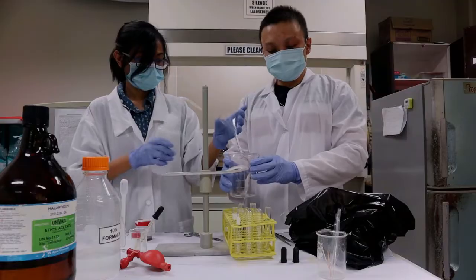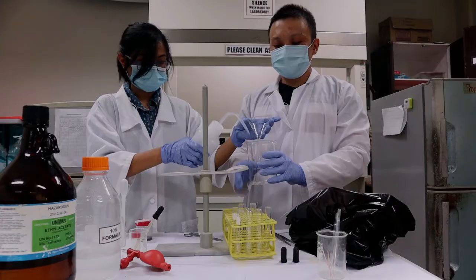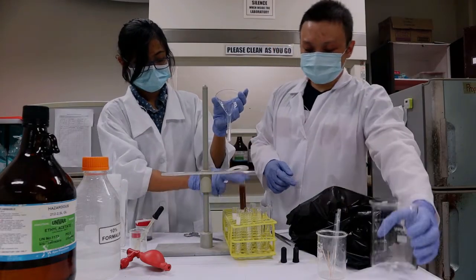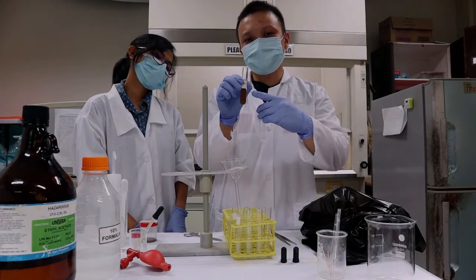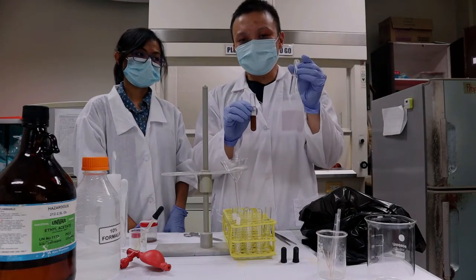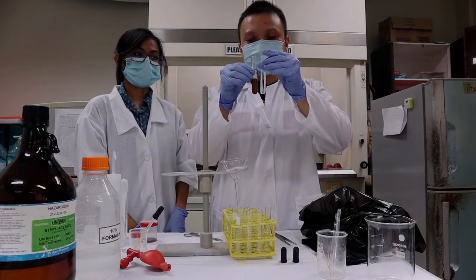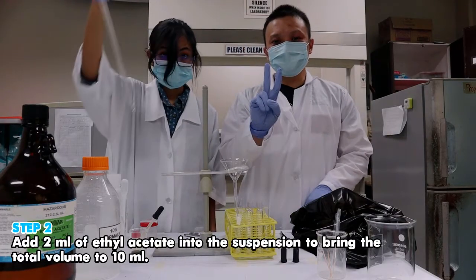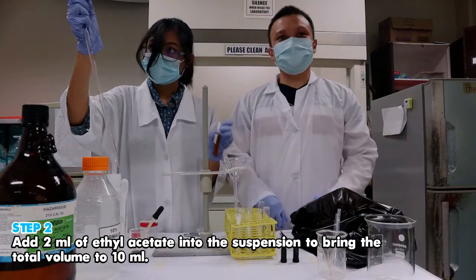Ma'am Ken will now rinse the funnel so as to clean the funnel. Now you can use it for another fecal sample. So as you notice, this will be our test tube for the sample. We have properly labeled it so as to prevent any confusion. And we have already made an 8 ml guide prior to this experiment so that we will see if you have at least 8 ml of the solution. So now we will add 2 ml of ethyl acetate so as to make a complete solution of 10 ml.